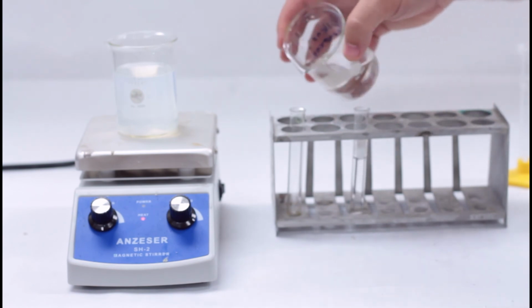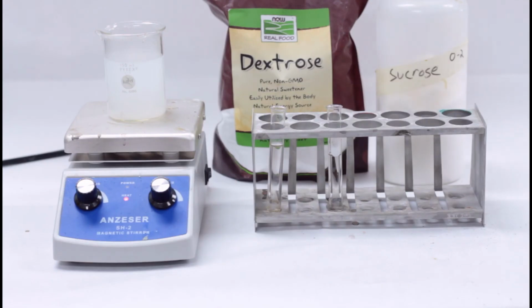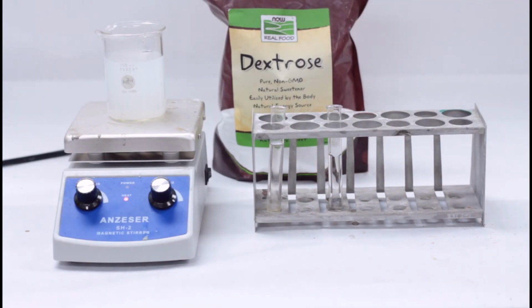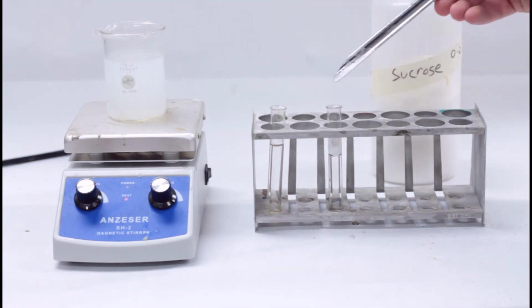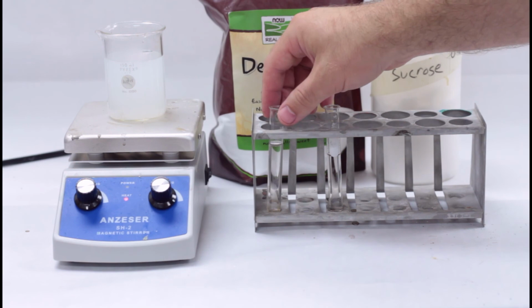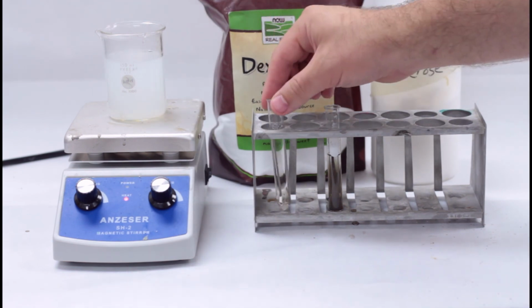Label 2 test tubes as you did with the Benedict's reagent and fill each halfway with Tollens' reagent. Pour a sample of sugar 1 into one test tube and sugar 2 into the other test tube. Heat each test tube in the same water that you used for Benedict's reagent. You should be able to time this out to have all the solutions ready at the same time. A positive Tollens' test will produce a cool silver mirror effect on the flask upon heating.